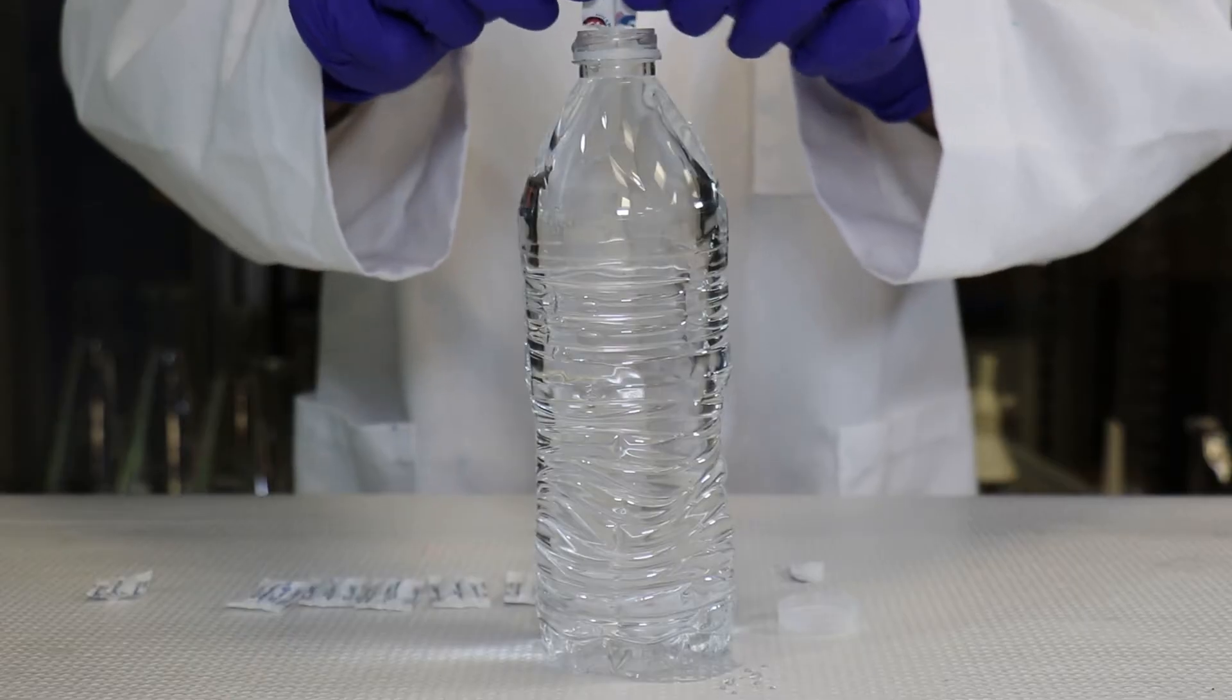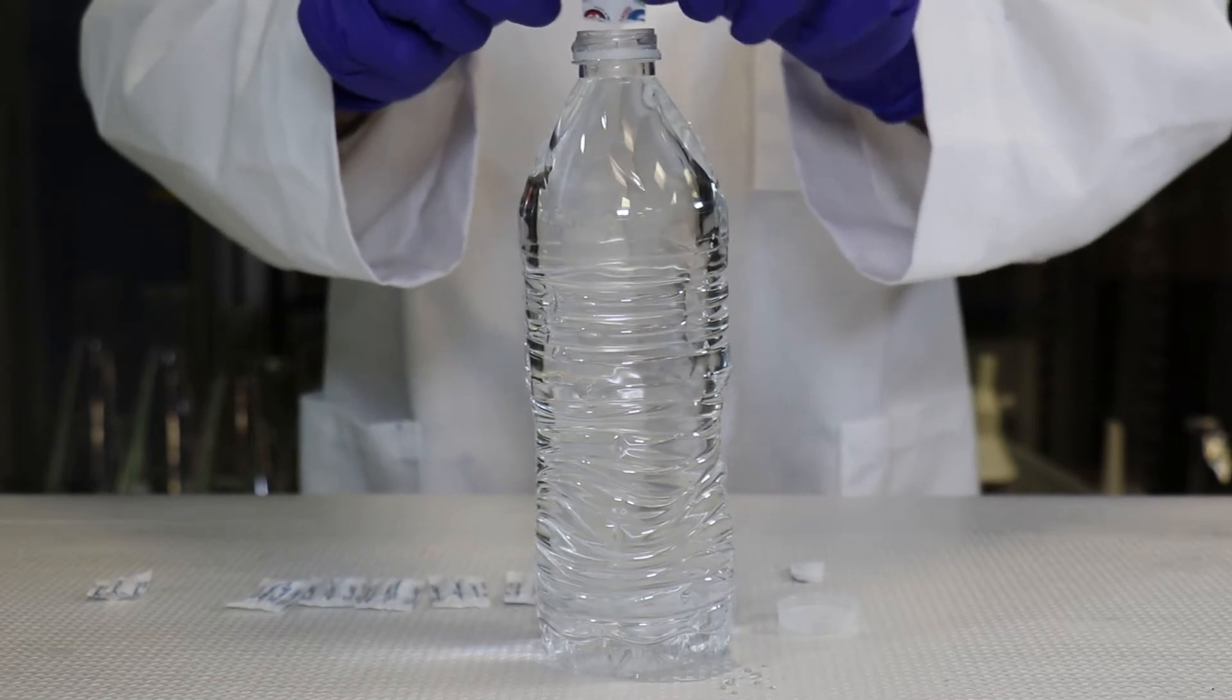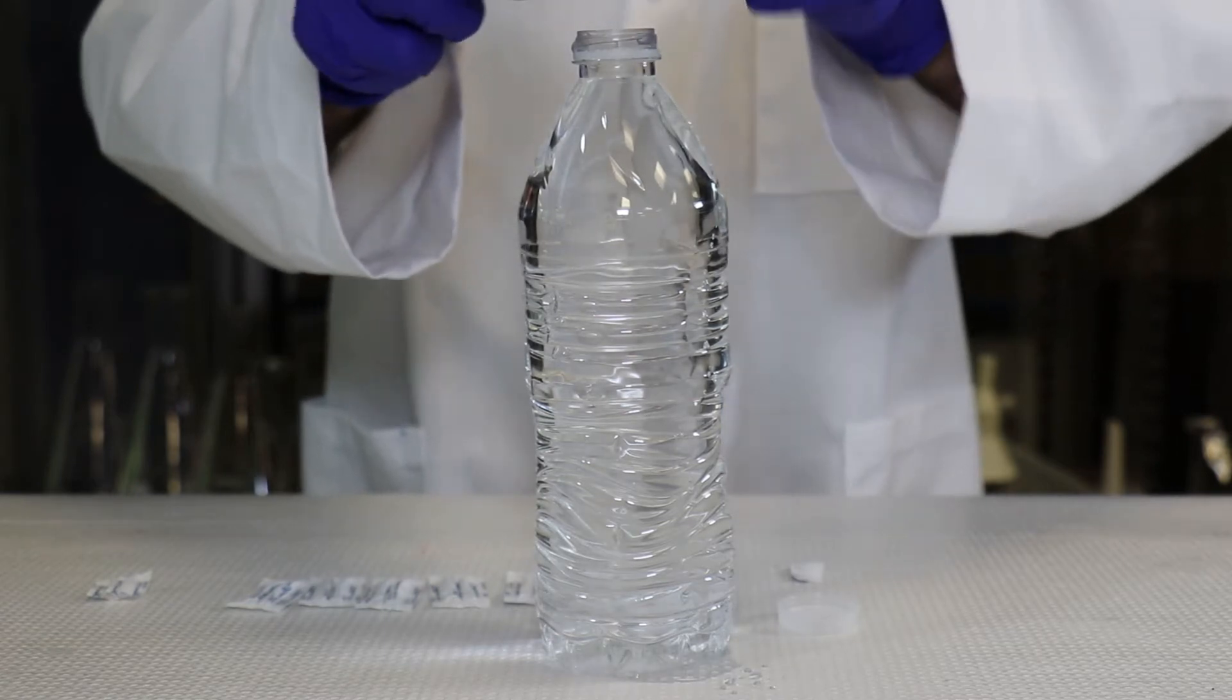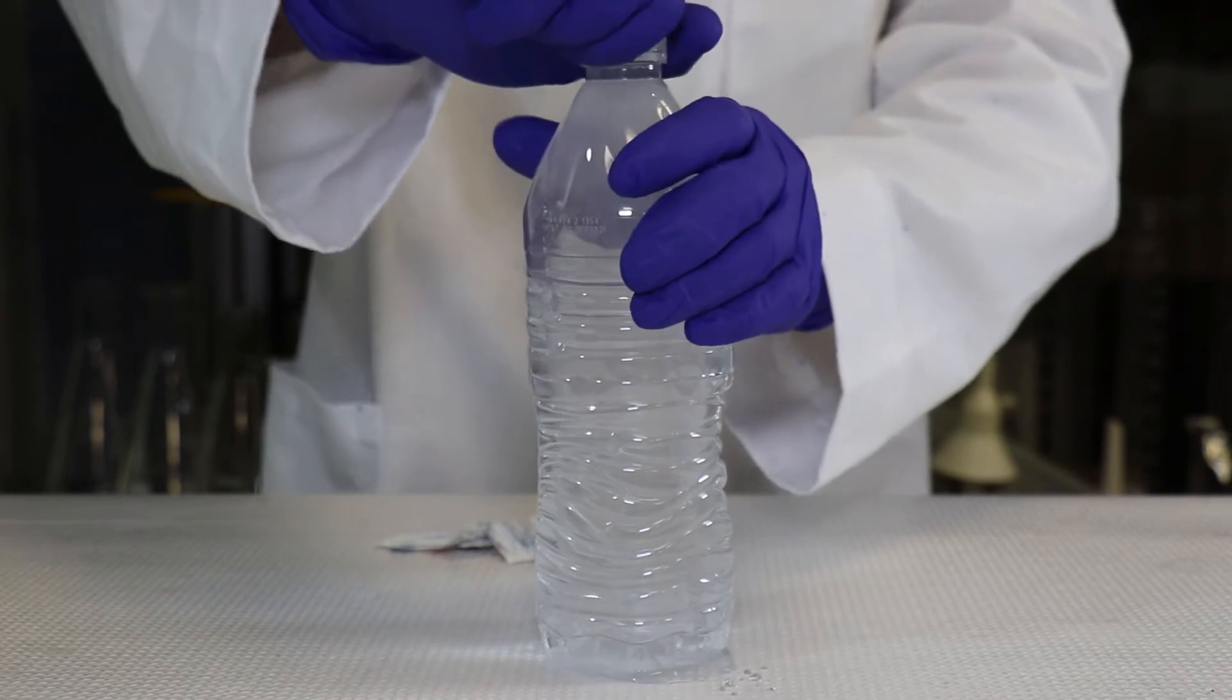Cap and invert the bottle to dissolve the salt. Step 2: aliquot 10 milliliters of this saline solution per small plastic cup.